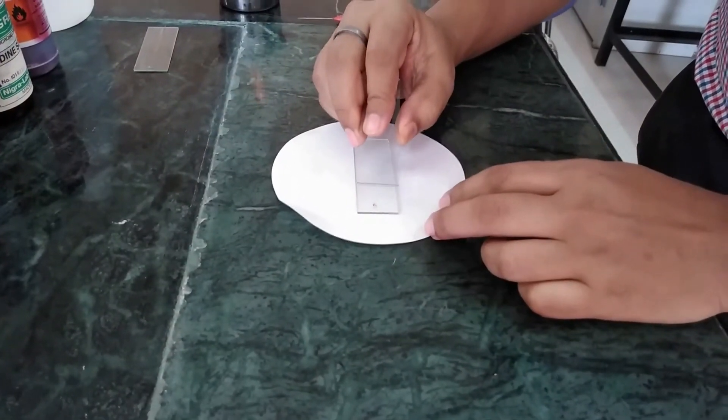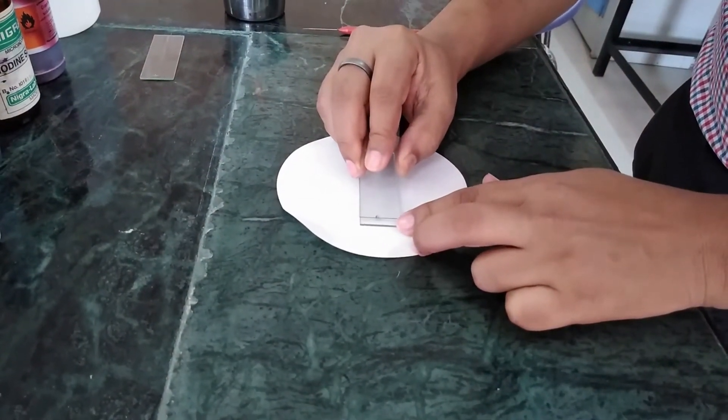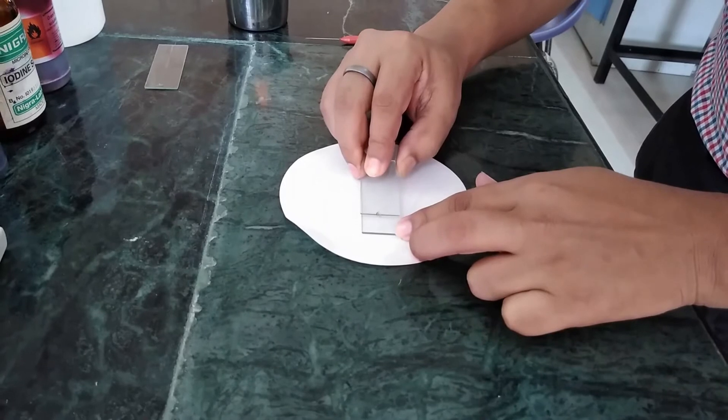After that, a thin smear is made. But care should be taken, the smear is very thin.